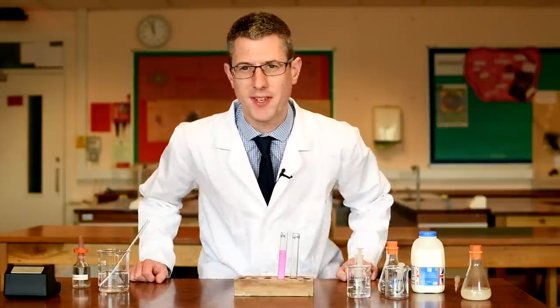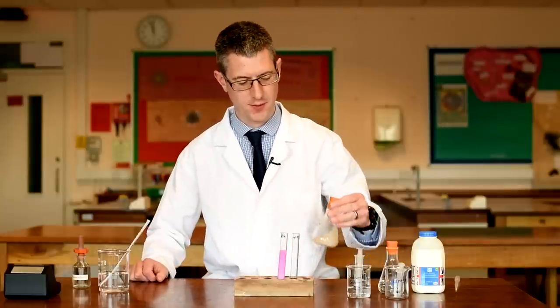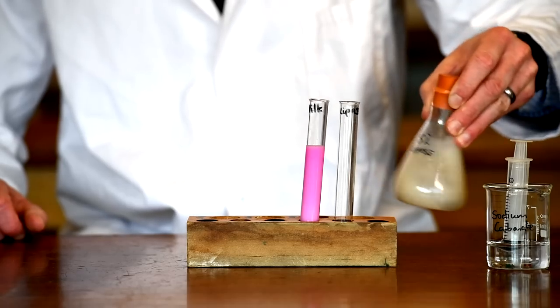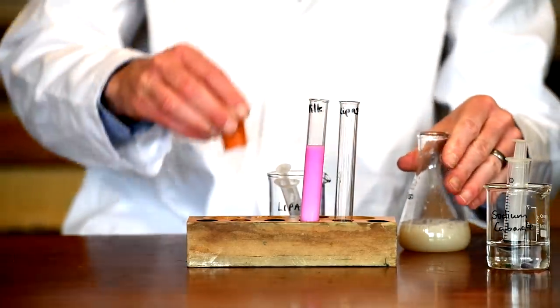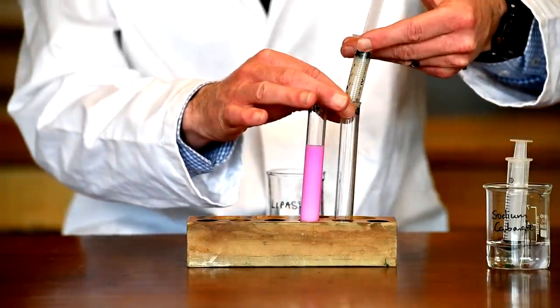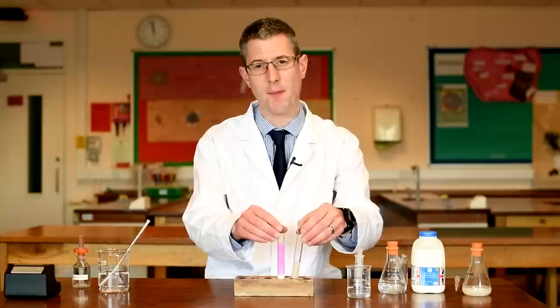So we've now set up our milk with the indicator in. We are going to use an enzyme called lipase, which we're going to add to our milk shortly. Often with lipase you find it's kind of solid in there, so give it a good shake to re-suspend it. We want 5 millilitres — 5 centimetres cubed — of lipase, and I'm just going to measure this accurately.